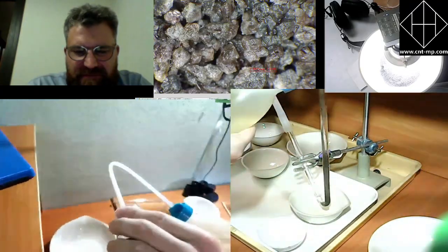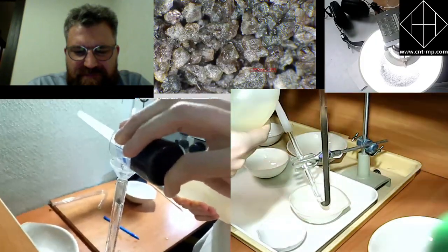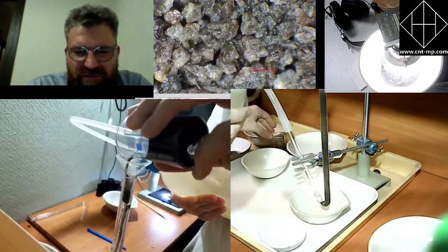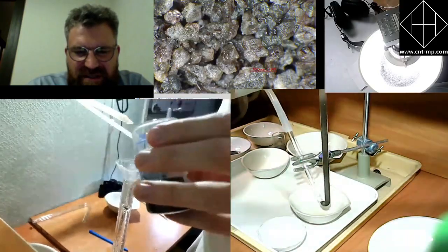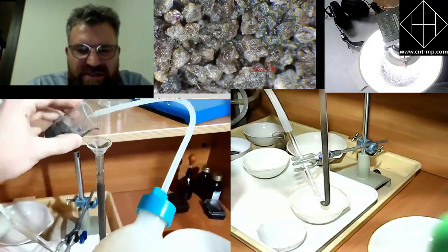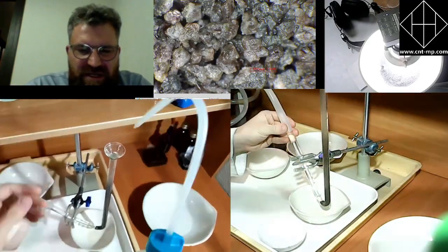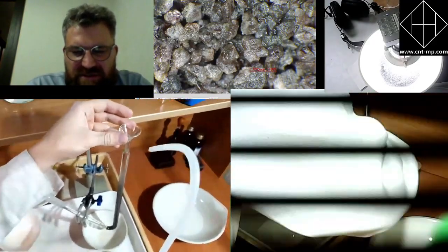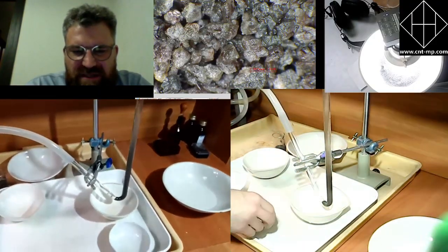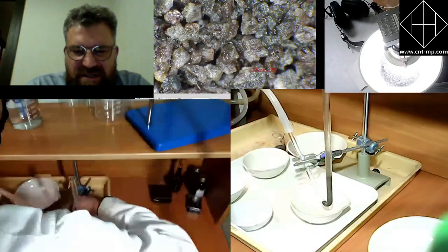Let's see. Alexander is loading more fraction to the GST. As you can see, this process is in batches. Guys, we don't have time for this training. Can you actually show us the preliminary concentrate to make sure that we've resulted some of the sulfides already in this first batch? Because we don't want to see the whole fraction processed simply due to no time. But you can see, guys, that he's feeding more fraction into the GST for another batch.